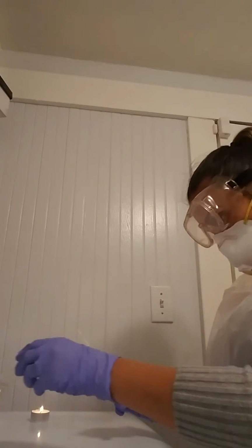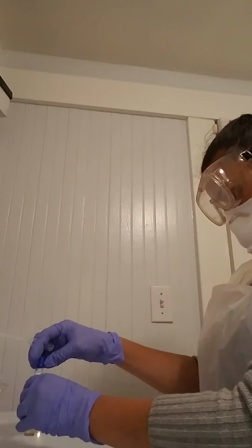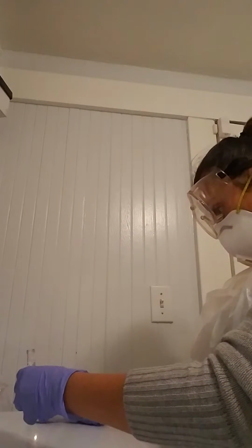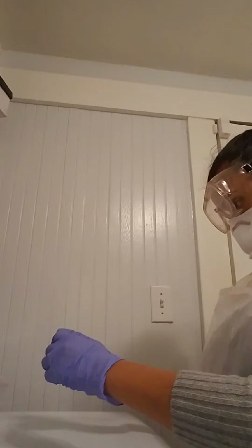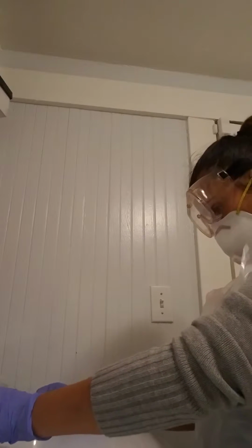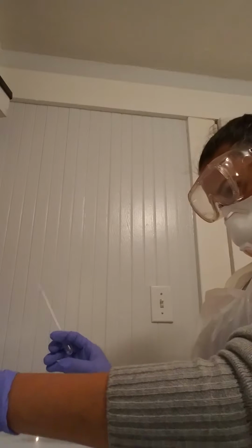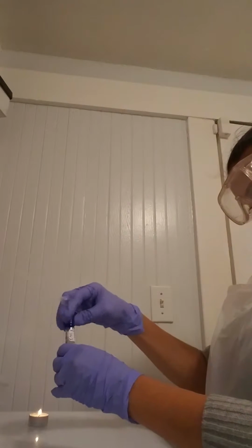So I'll have to sterilize the E. coli. I'll sterilize the MRVP broth.